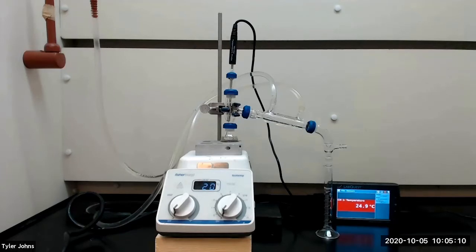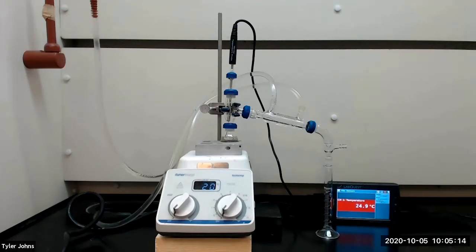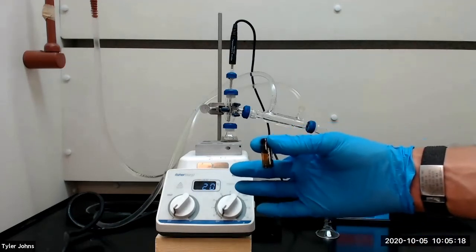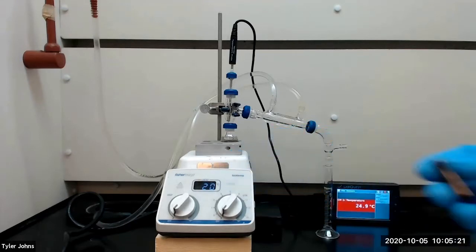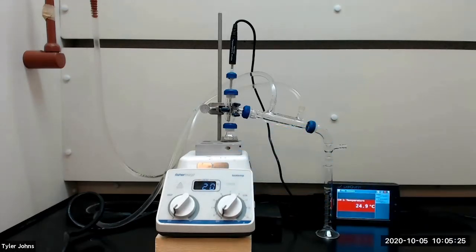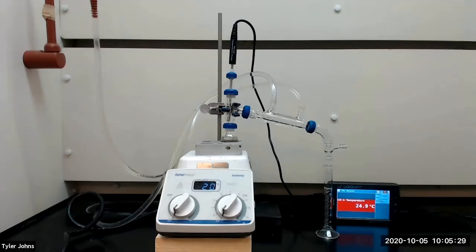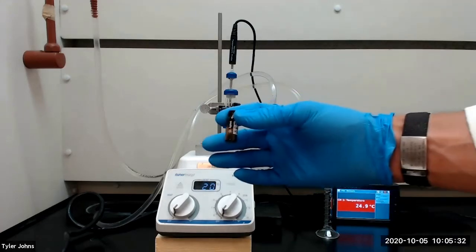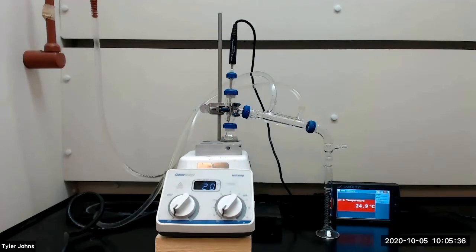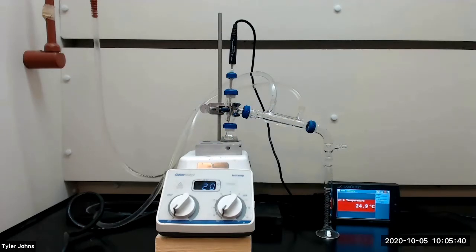After we have collected one milliliter of distillate, we will remove the 10 milliliter graduated cylinder and collect the next three to four drops of distillate in a gas chromatography vial and cap tightly. We will then resume collecting the distillate in the graduated cylinder. Once we've collected 5.0 milliliters of distillate, we will take another sample in a second GC vial, then continue the distillation until 0.5 milliliters of unknown remains in the round bottom flask.